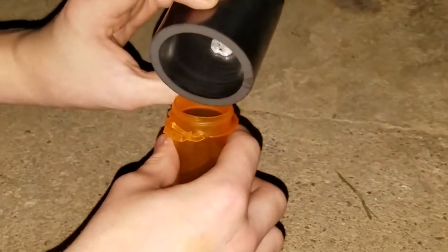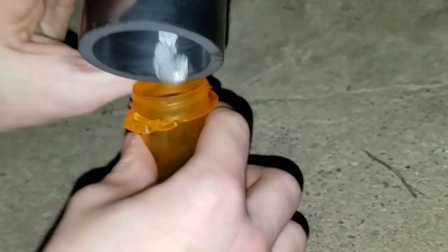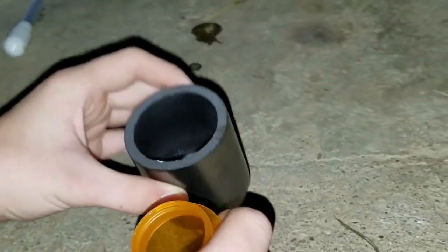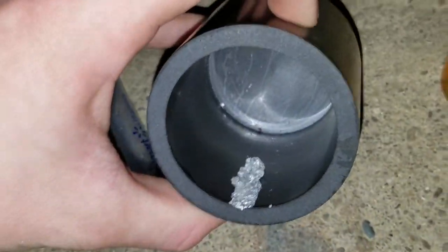I don't want to pause the video. Alright, so we're going to pour it in this bottle and then pour some acid in there. It actually looks disgusting. It's going to be delicious. And not the drugs. Quit moving it so it can focus. There you have it. Yeah, it's pretty cool. Now how are we going to clean that? I want to keep that. I want the actual Galinstan.